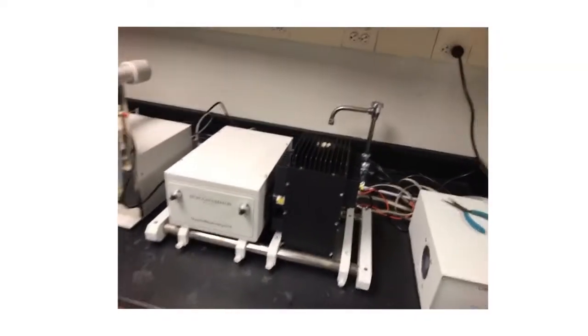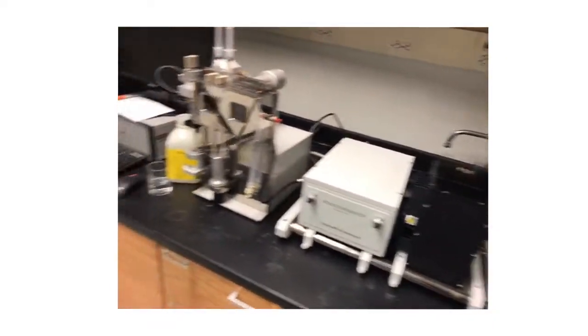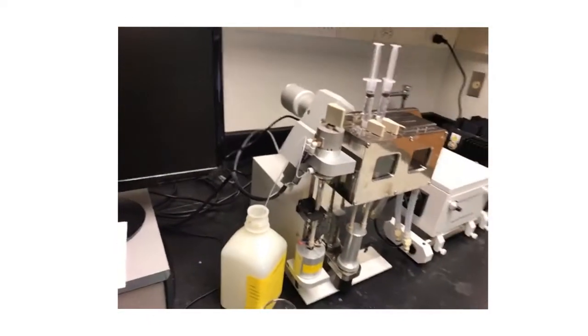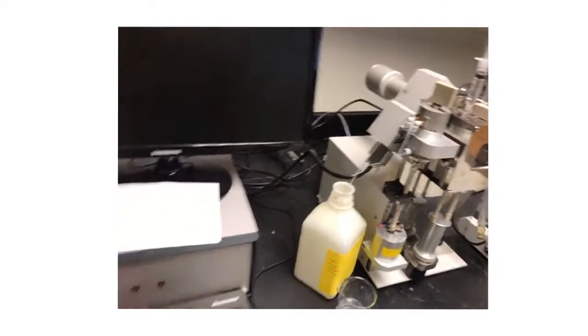We have a gas cylinder. This is nitrogen gas. This gas is just simply going to power the pneumatic that allows the mixing of the liquid sort of on-demand using the computer software.